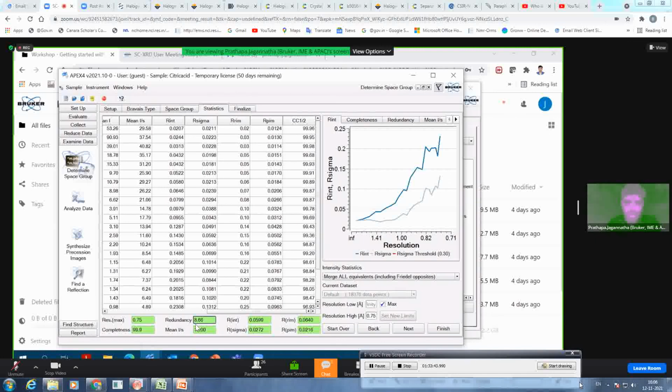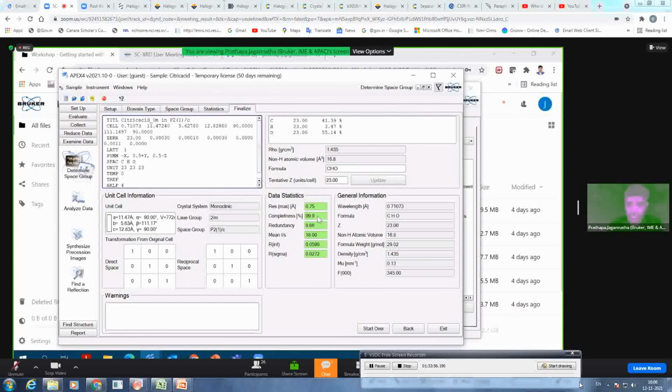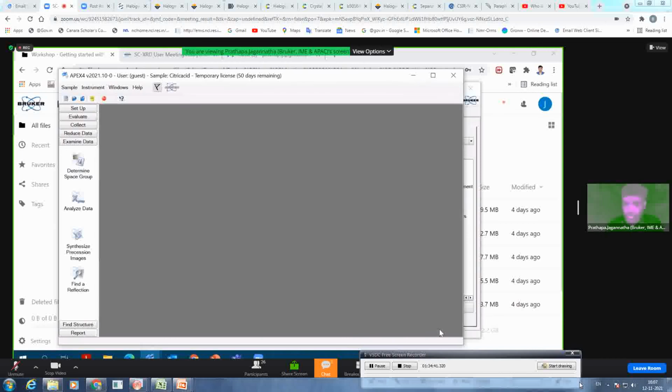Along with that, you get the main important factors of your crystallography, or the quality of your data: completeness, redundancy, and it comes with color coding as well. In the next option, you can find it better. You get this data statistics, and if there is any warning, it will also give you the warning here. If it is green in color, then you know everything is good. If it is yellow or orange, it's OK or borderline data. If it is red, then please look into that particular value. If completeness is less than 95 or 96, then you get the red line and the warning, completeness is poor. So it tells you about the quality of your data without looking at different files. And also, if any transformation matrix is applied, you get the information about those things from here. And it also creates an ins file after you determine the space group.